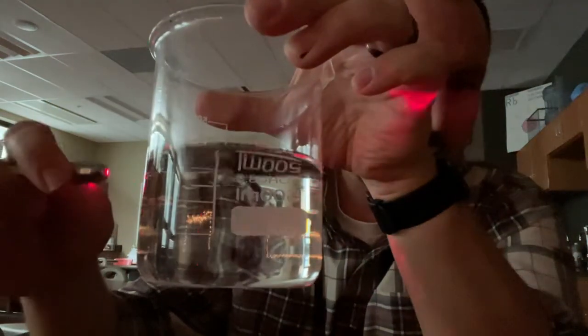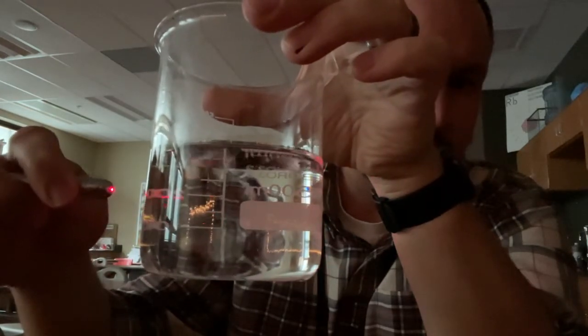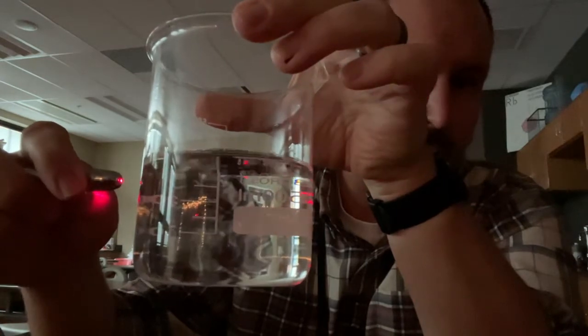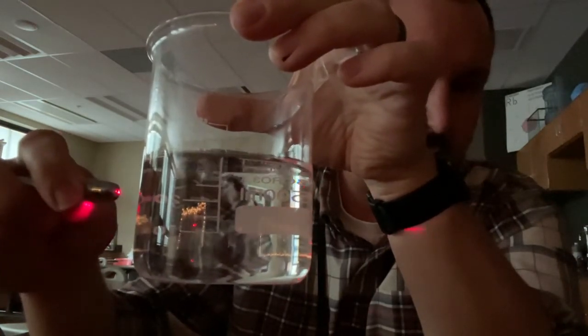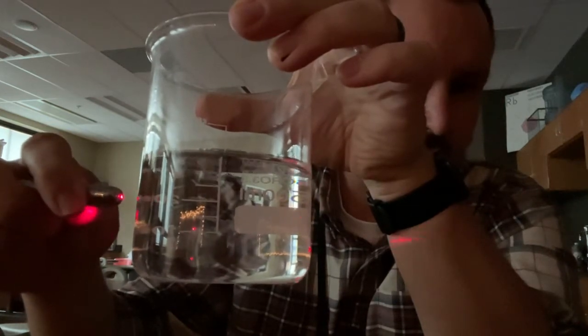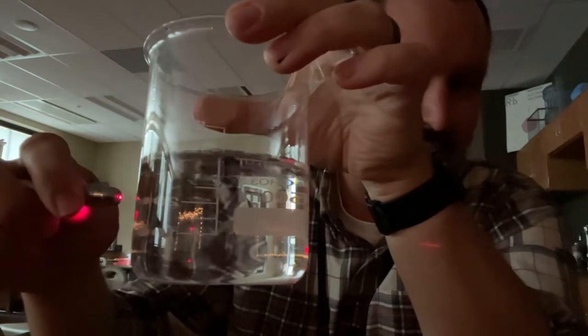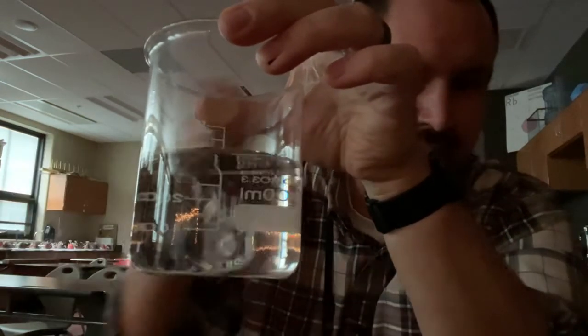And lastly, let's go to vinegar. Vinegar is a mixture. We'll turn this around so you can see a little bit better. And can you see the laser beam? Is it showing the Tyndall effect inside the water? I mean, sure, I can see redness, but I'm talking about the laser beam going through the liquid itself. So that should give you a clue. Keep in mind, this is a mixture. It's actually water and acetic acid put together. So that might give you a little bit of a clue as to what this is.